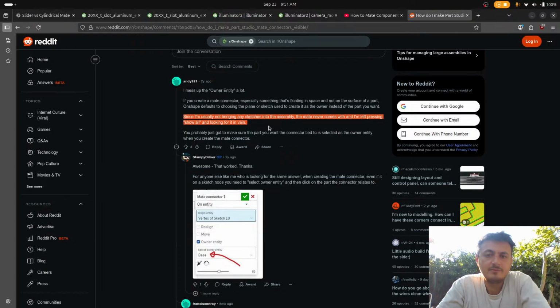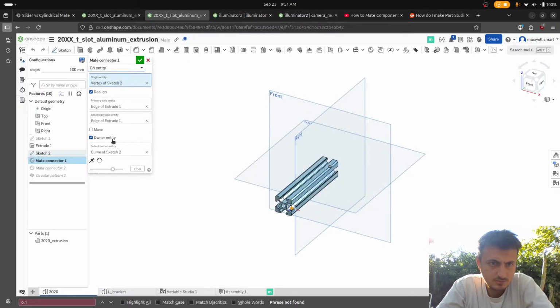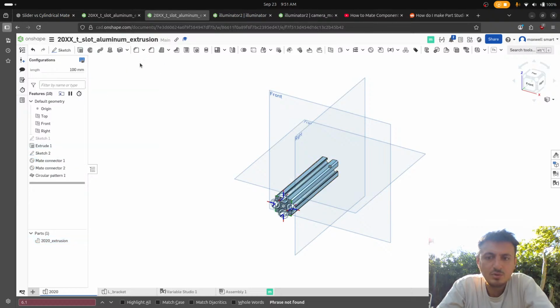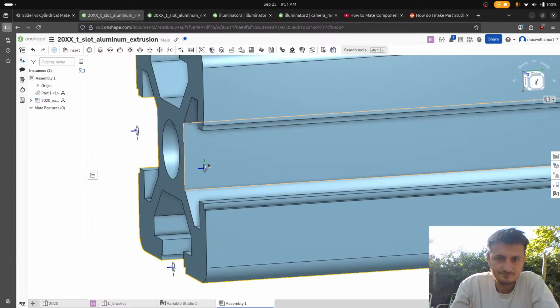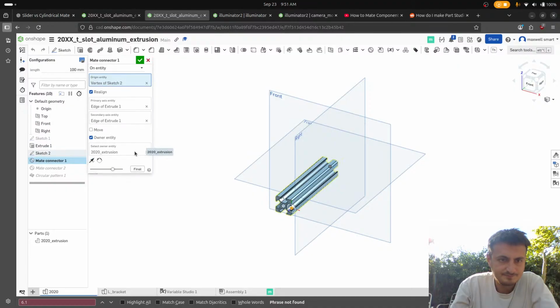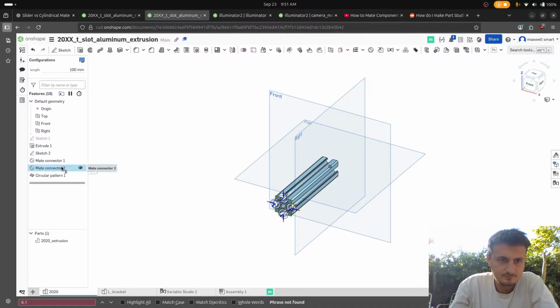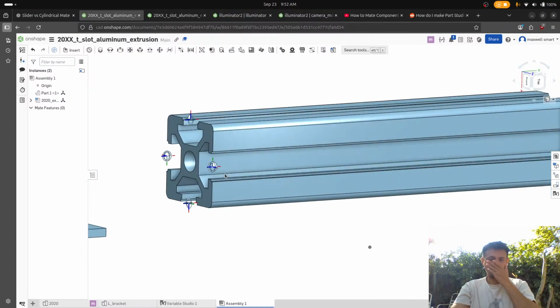Oh, okay. So yeah, my mate connectors are owned by. Oh wait, owner entity. Oh, interesting. We can just select the part. Yeah, boy. So that'll probably work, won't it? Wait, why do we only see one of them? Oh, because we didn't do both of them. Beautiful. Okay, so that's cool.